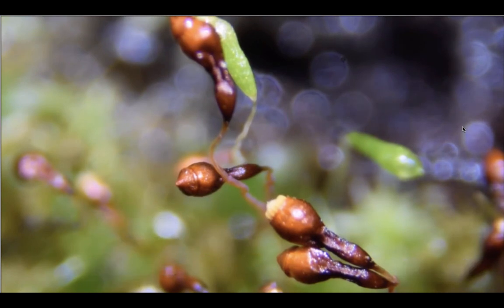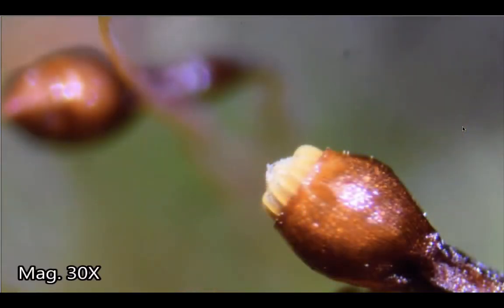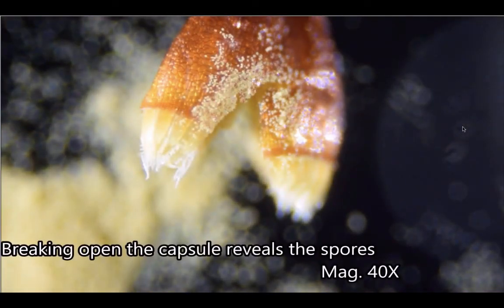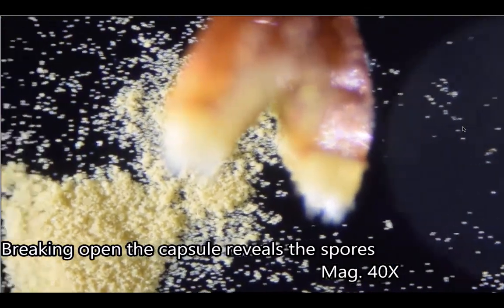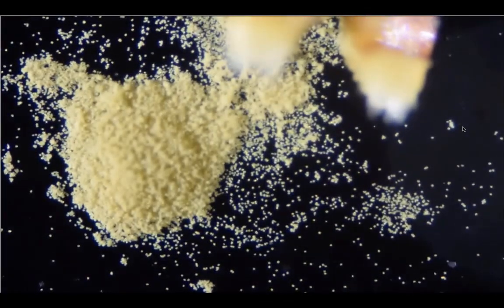You can see them flowing out there. They're very small. They're numerous as well.